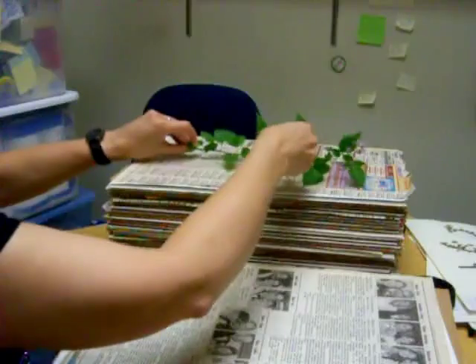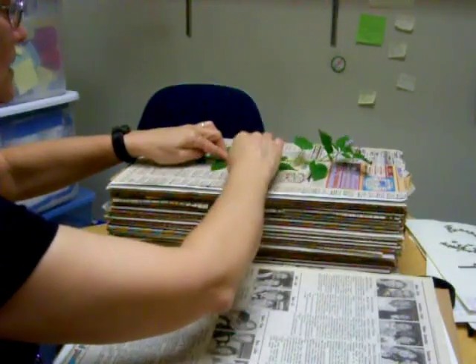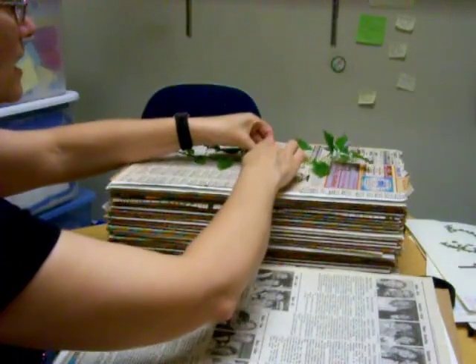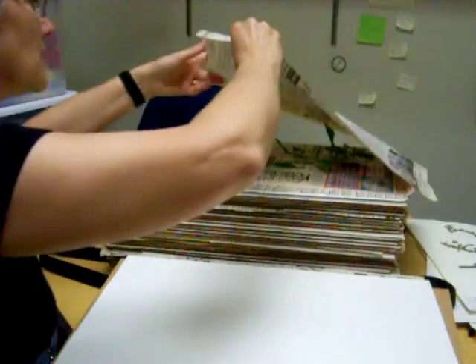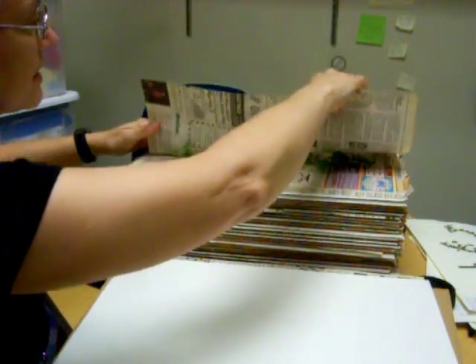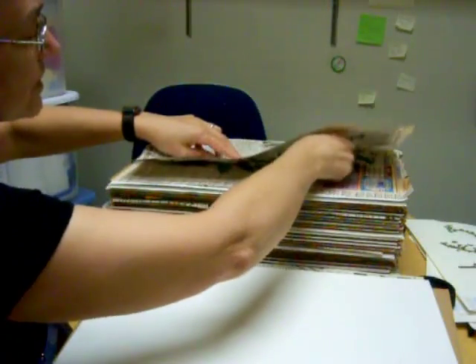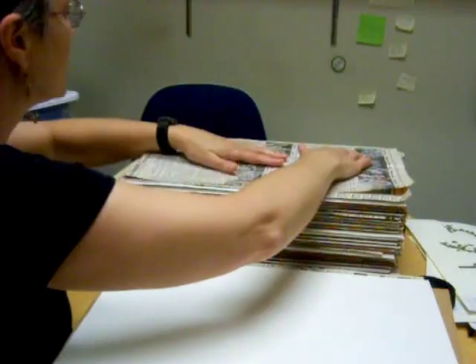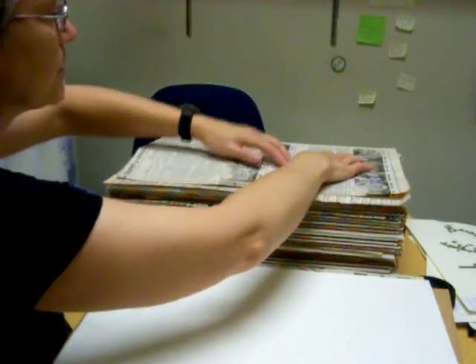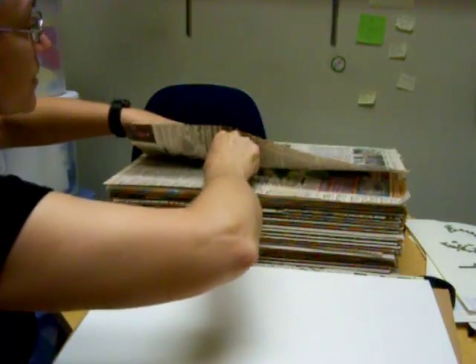Here's the first specimen. It might help to have two people, but I'm going to try to make sure that all of these leaves are separate and not underneath. I can do that carefully by watching what happens when I lay this on top and position everything. It's a good idea to turn some leaves right side up or bottom side up. Working with a friend helps too. Flatten that out, peek to see how you did, reposition a little bit, hold it down, add the blotter paper, then add the cardboard.